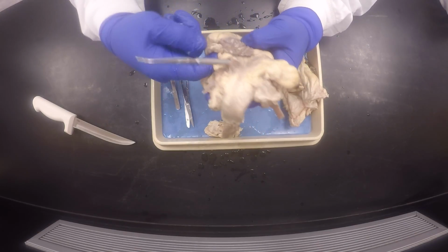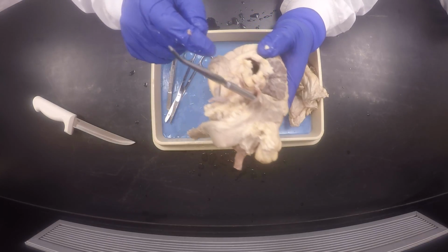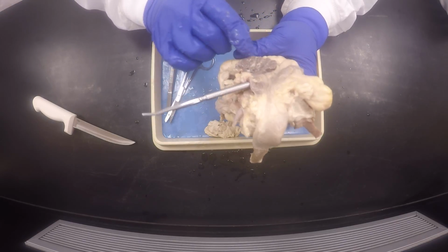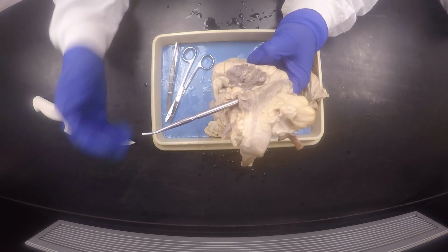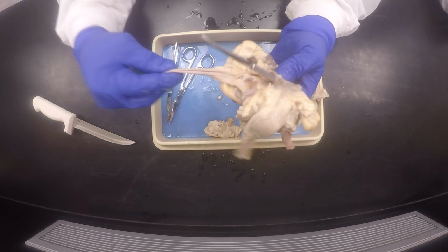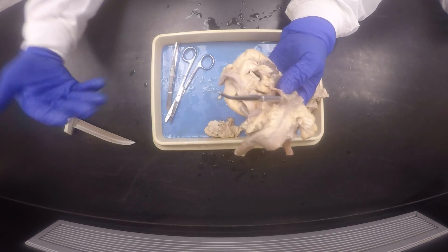So this is probably part of the superior vena cava right here. You see how they really cut it off. That is probably where we had the vena cava, which is the one getting deoxygenated blood from the systemic circulation. It goes out through the pulmonary trunk to the lungs to pick up oxygen, and comes back through these pulmonary veins, I'm sorry, carrying oxygenated blood, but they're veins because they're heading towards the heart.